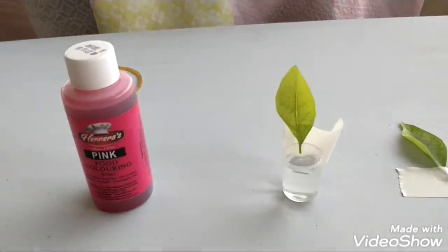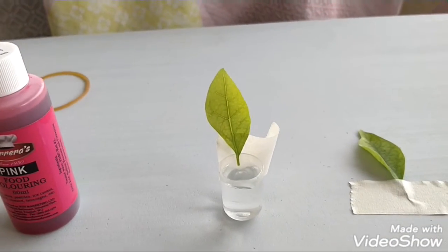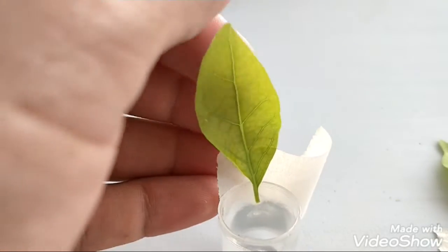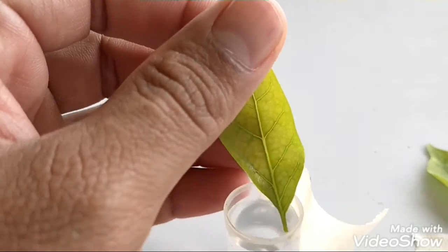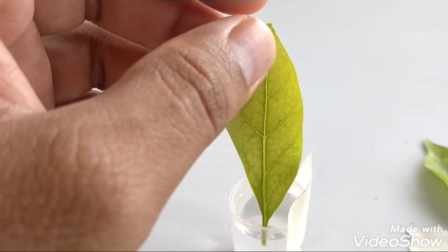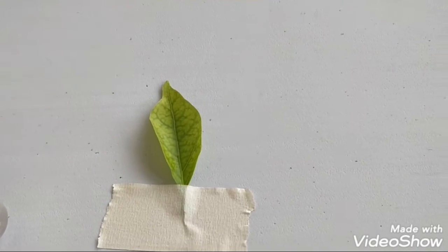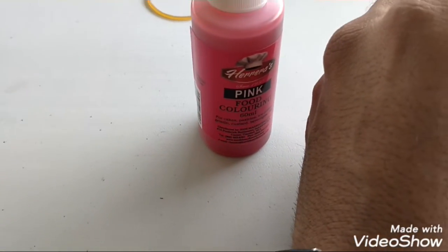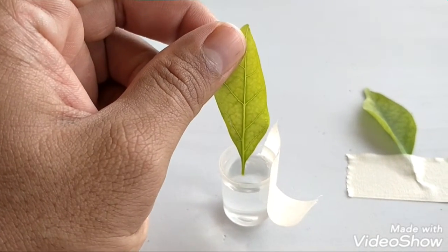In the meantime while that experiment is running, I'm going to show you a different one where we can look at how water moves in the leaves. Here we have two leaves — they're very close to transparent so you can actually see most of the veins. I'm going to leave one out of the solution as my control, and for the other, I'm going to put some pink food coloring in it so that if any water moves up into the leaf, it'll show up in the venation.